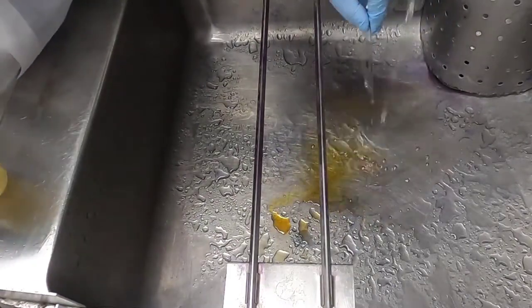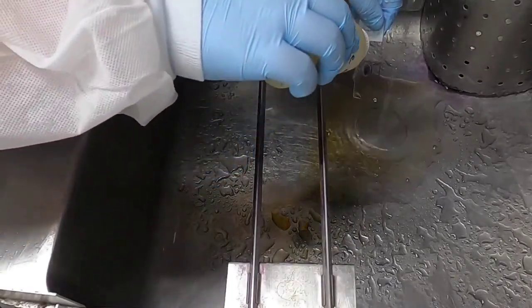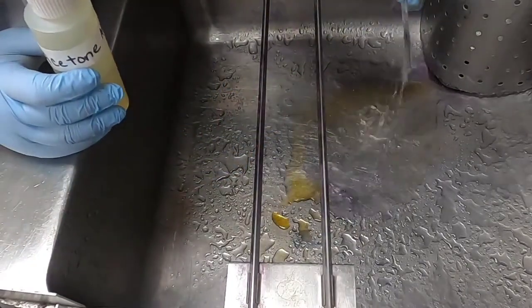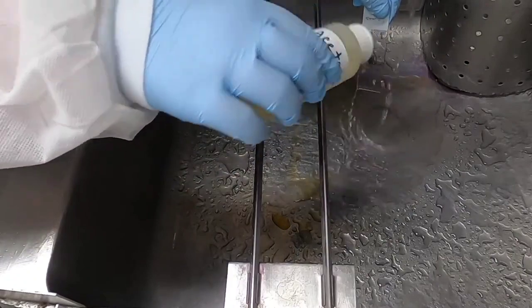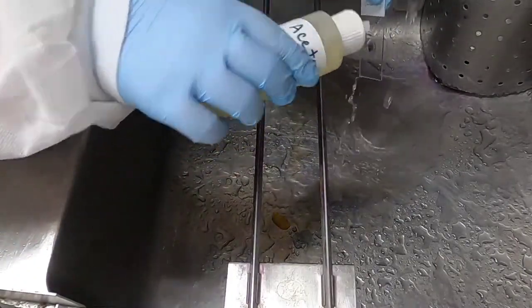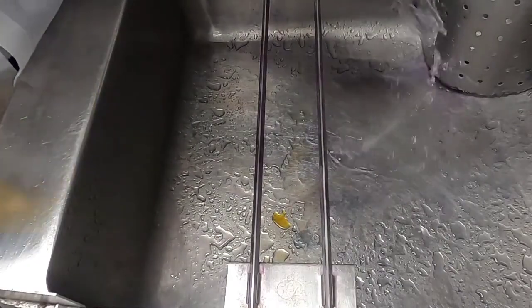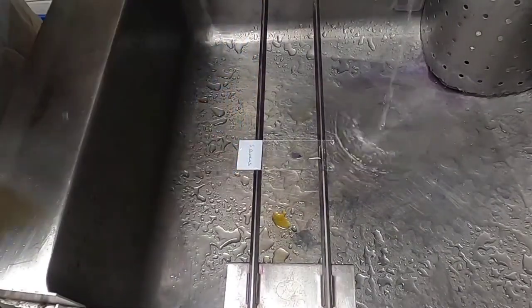The next step is decolorization, and this is a really critical step in the Gram stain. Flood the slide with acetone and rinse off quickly — you want to do this until the water runs clear. Be careful not to over-decolorize your cells, or Gram positive organisms can look Gram negative.